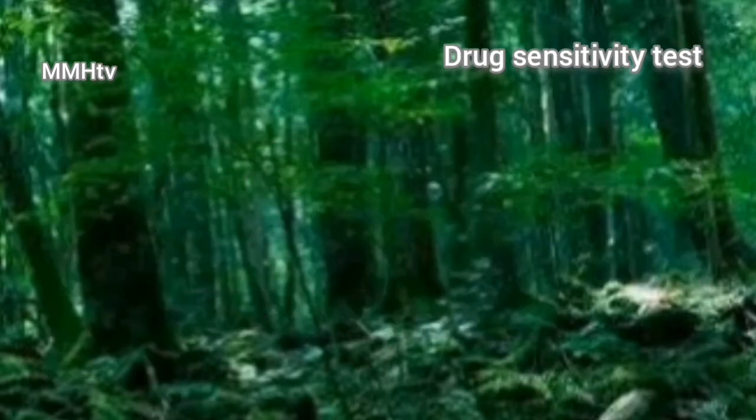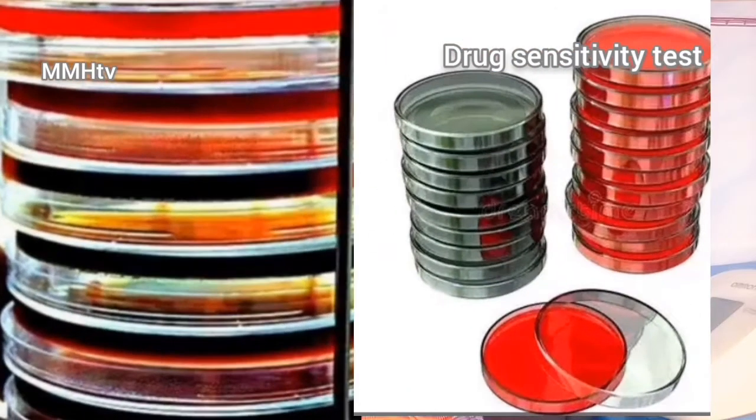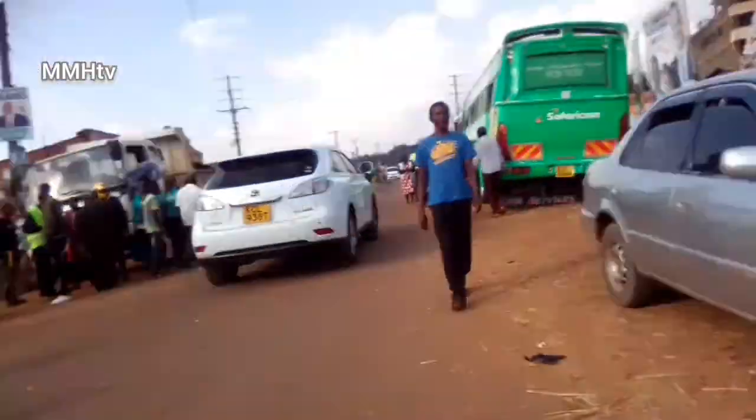Kenya Medical Research Institute, KEMRI, has all these types of bacteria stored and ready for use in research by people like us. So you don't need to go out looking for patients and collecting the bacteria. They are already there. You must also know the plants that contain the specific antibiotic properties that you want. The plants you use are the ones that you think can treat particular diseases because of their chemical properties.